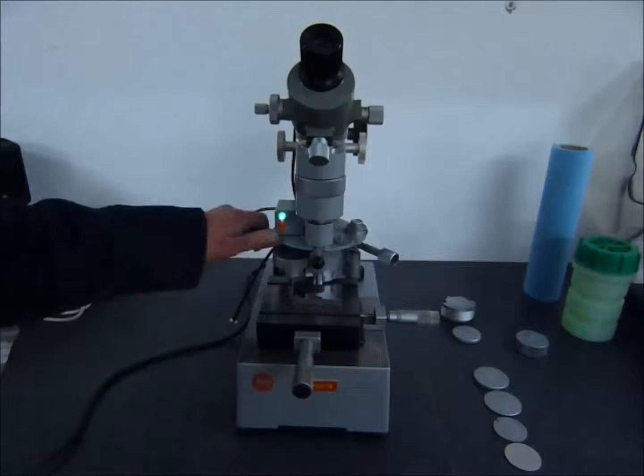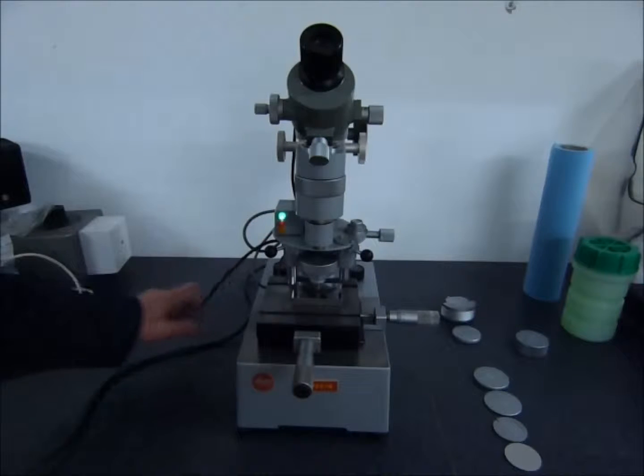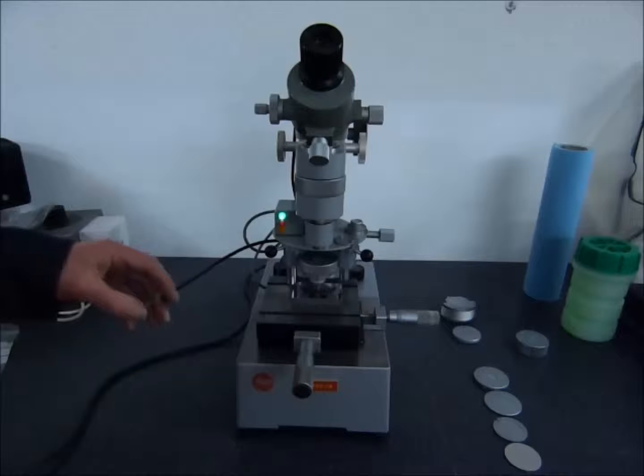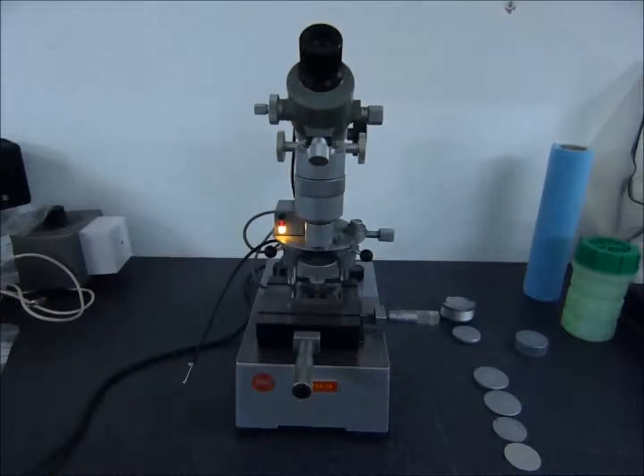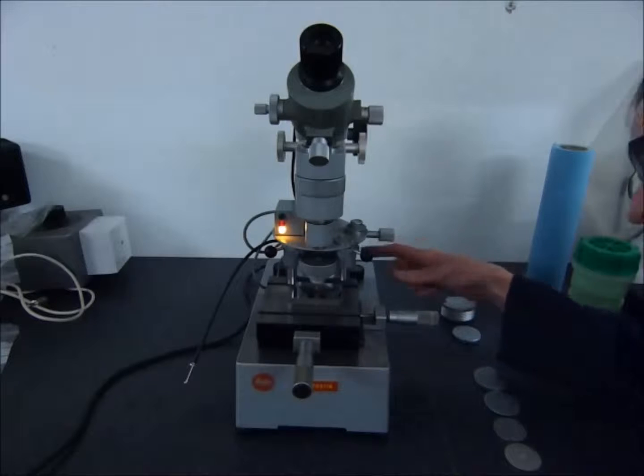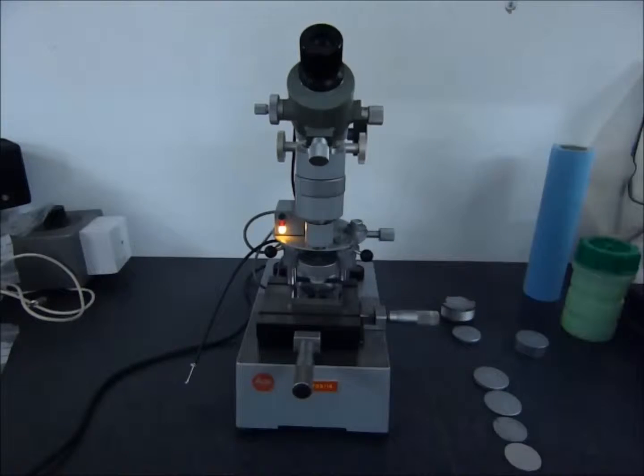So for example, putting the indenter in place, pressing the plunger. The arm starts to move and you count roughly 15 seconds until this arm indicates that it's reached the backstop. There will then be a dwell time while the indenter is in position and that's basically that.